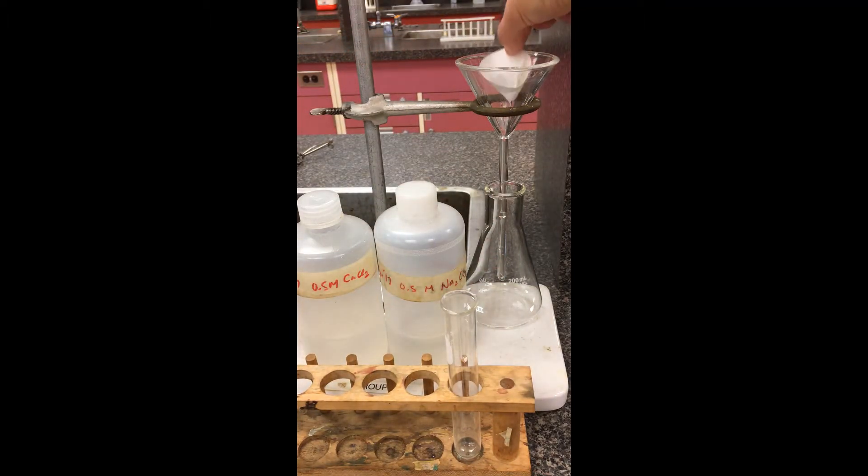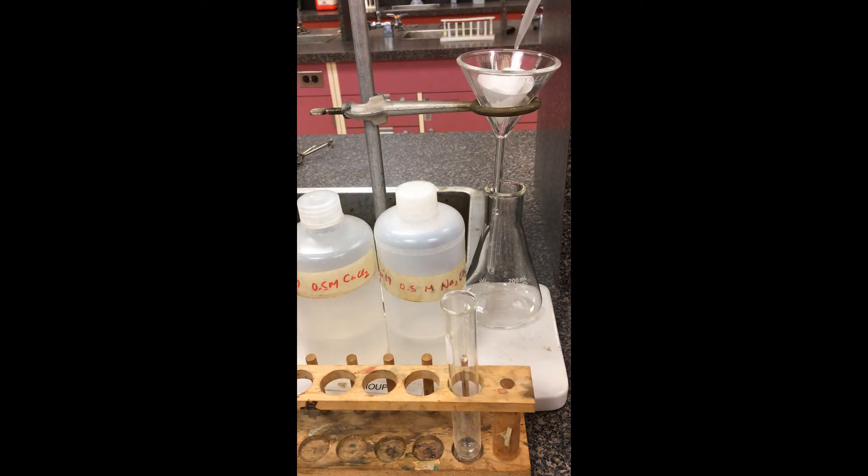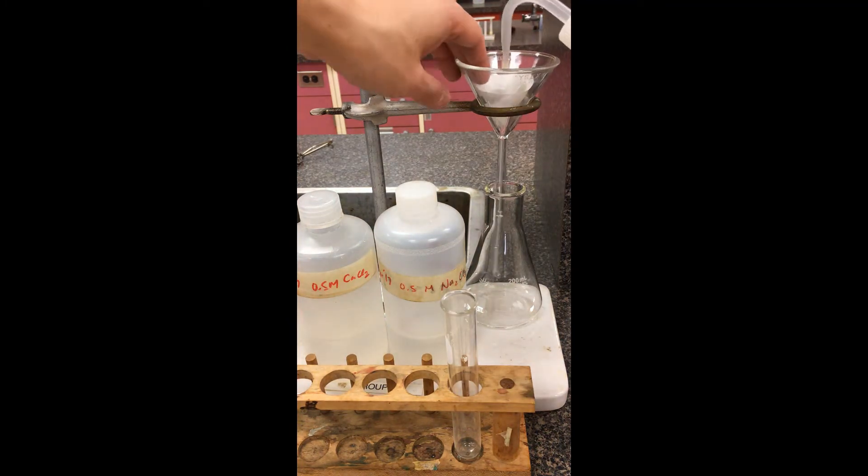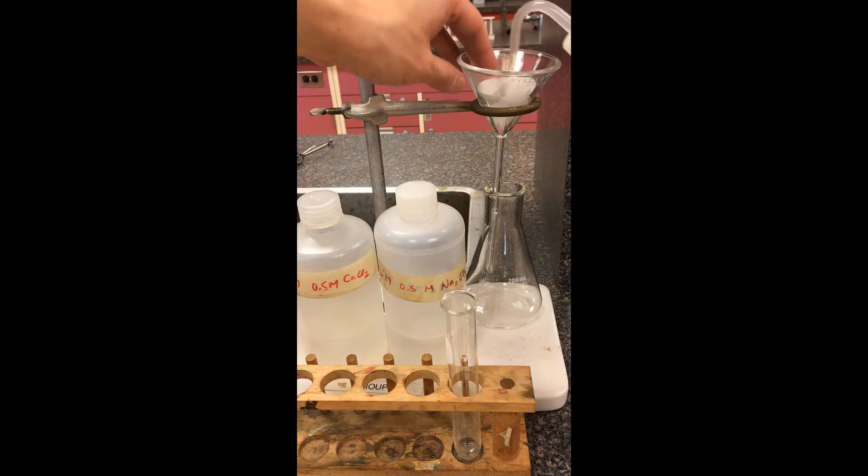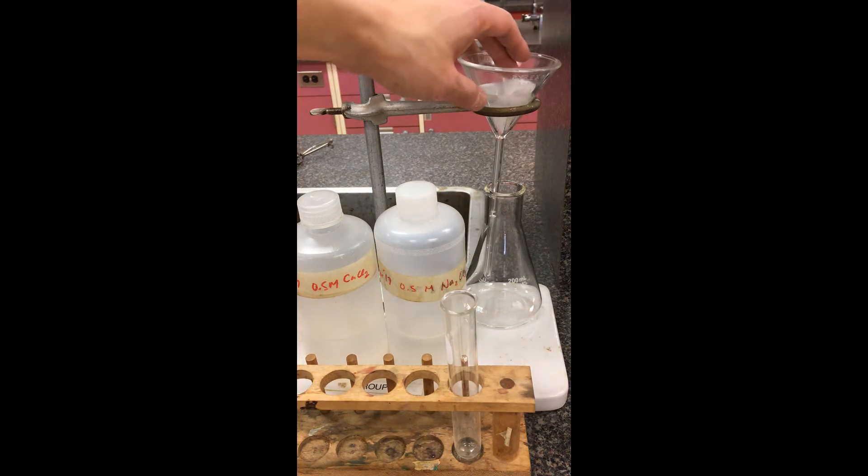So I'm just going to plop this into the funnel here. Remember, I had already pre-weighed it when it was dry. After collecting up the residue, we're going to put in a little bit of water just to make sure it sort of retains that shape there.